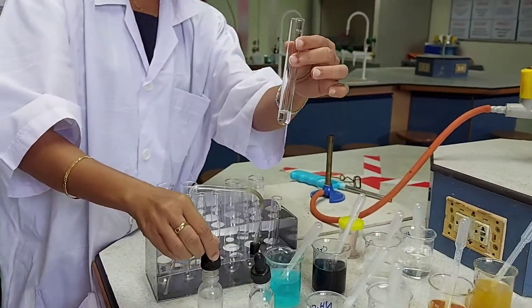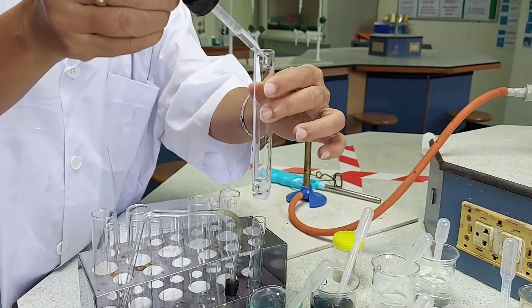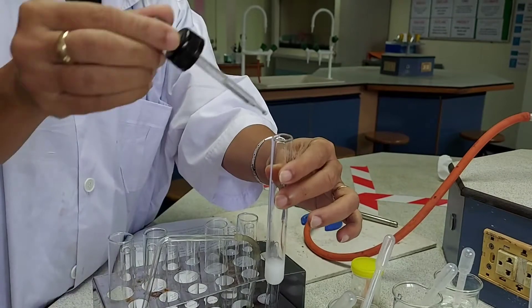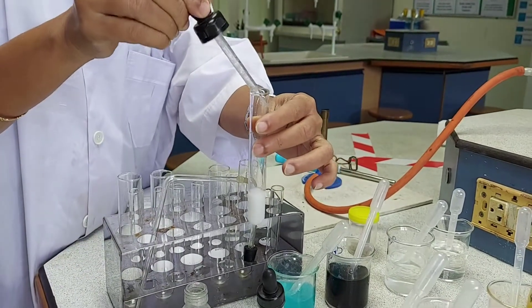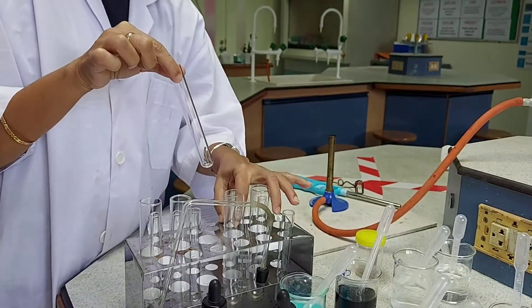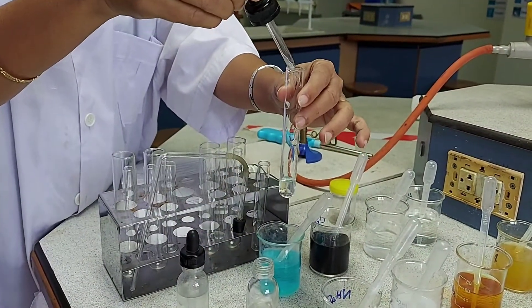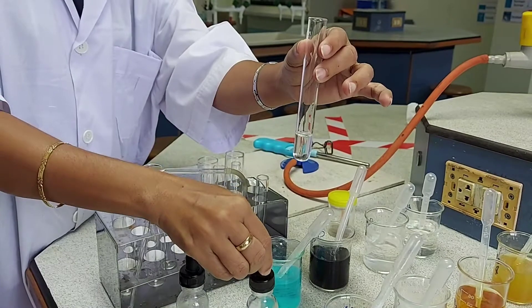Now let's take the next solution. About 2 cm³ of the given solution is taken to test for the metal ion present. Adding a few drops of sodium hydroxide initially, you can see a white curdy precipitate — a thick white precipitate — is formed. When I add excess of sodium hydroxide, the precipitate remains; it is insoluble in excess. I repeat the same with ammonium hydroxide, adding drop by drop and then in excess. No precipitate is formed.